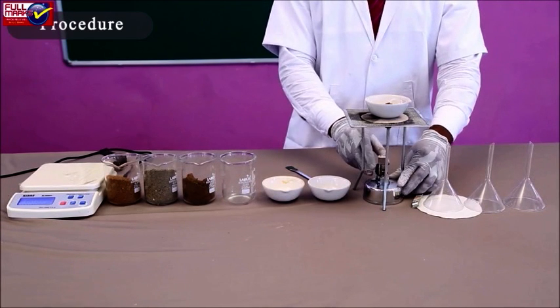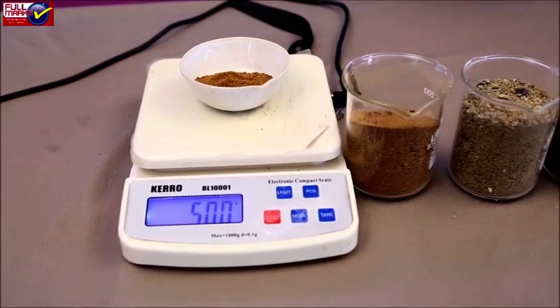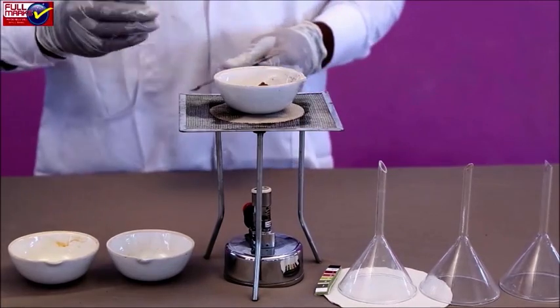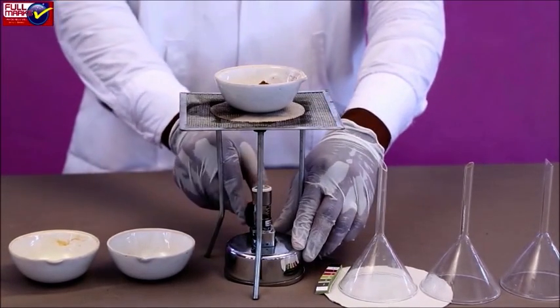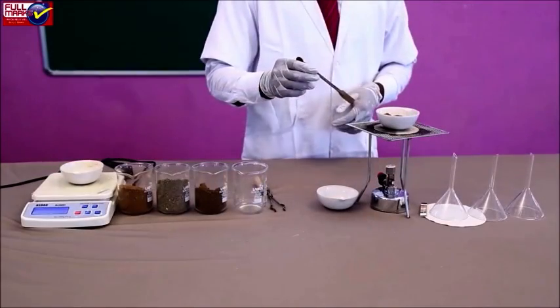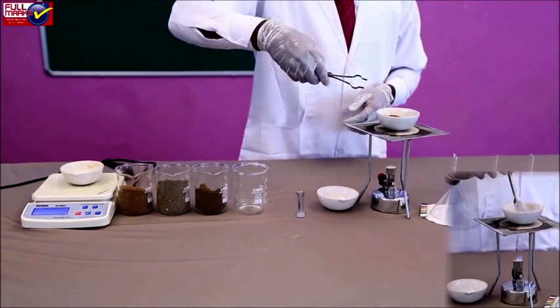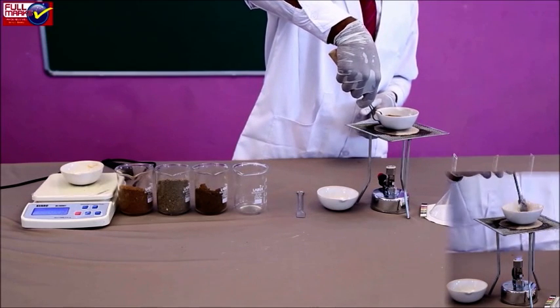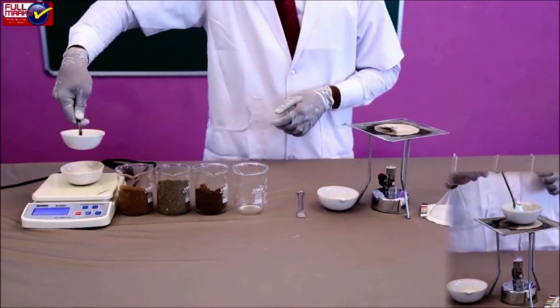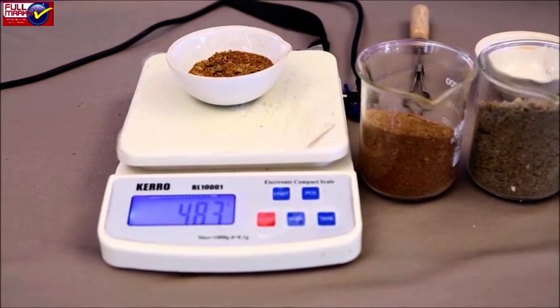Procedure: Collect the soil samples from different fields. Take a small amount of soil from a sample in a crucible and weigh it. Place the crucible over the burner for a few minutes and heat the soil until it becomes dry. Allow the crucible to cool and weigh again. Repeat this process until the water content of the soil evaporates completely and the weight of the dry soil becomes constant. Repeat the process for other soil samples also.